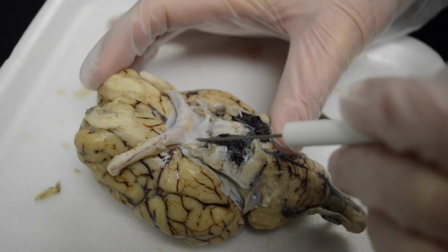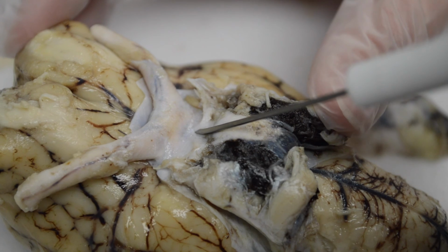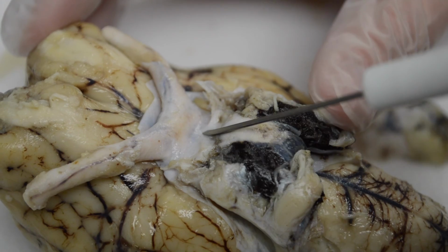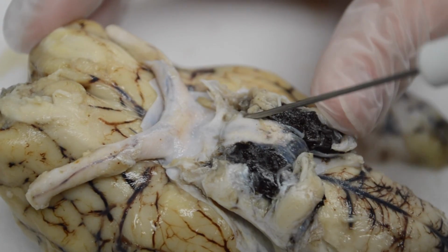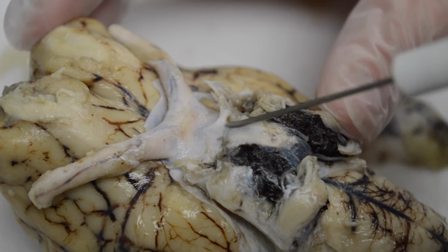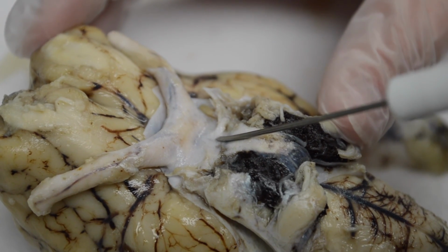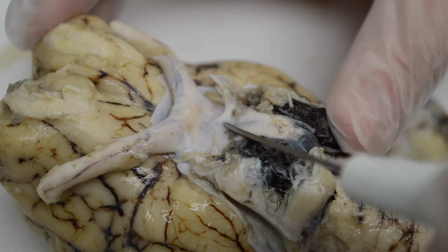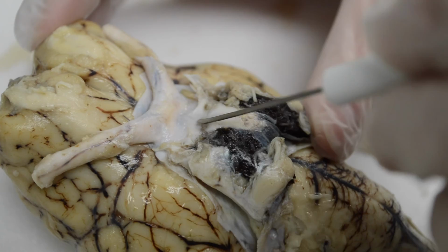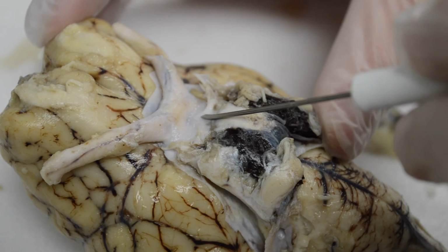So just behind here would be where the infundibulum is. What the infundibulum is, it's a connection between the hypothalamus, deep inside, which we'll take a look at once we do a cut, and the pituitary gland. So the infundibulum is the stalk, and it's right behind the optic chiasm, and it holds the pituitary gland. Now, pituitary is missing, so we don't have that to look at, but that lies right behind, that's been removed because it's not contained within the dura mater.